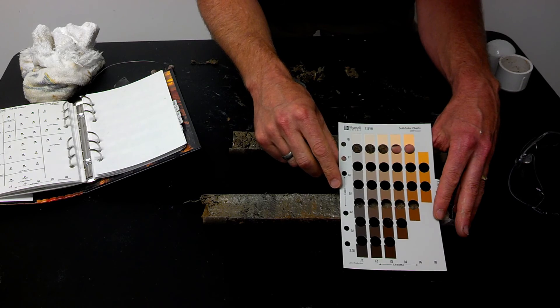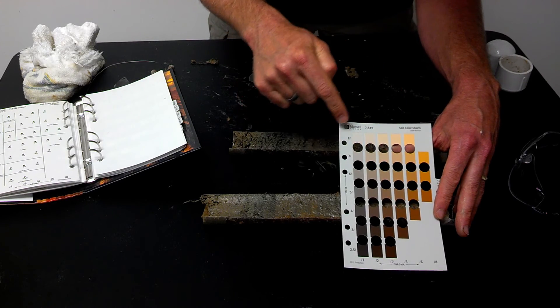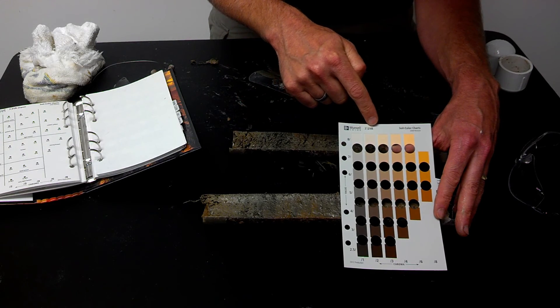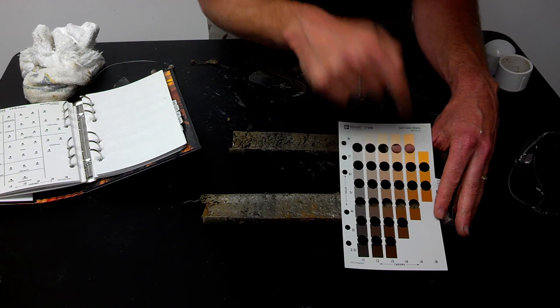So the analysis of this particular area may be 7.5YR, 4, 6.